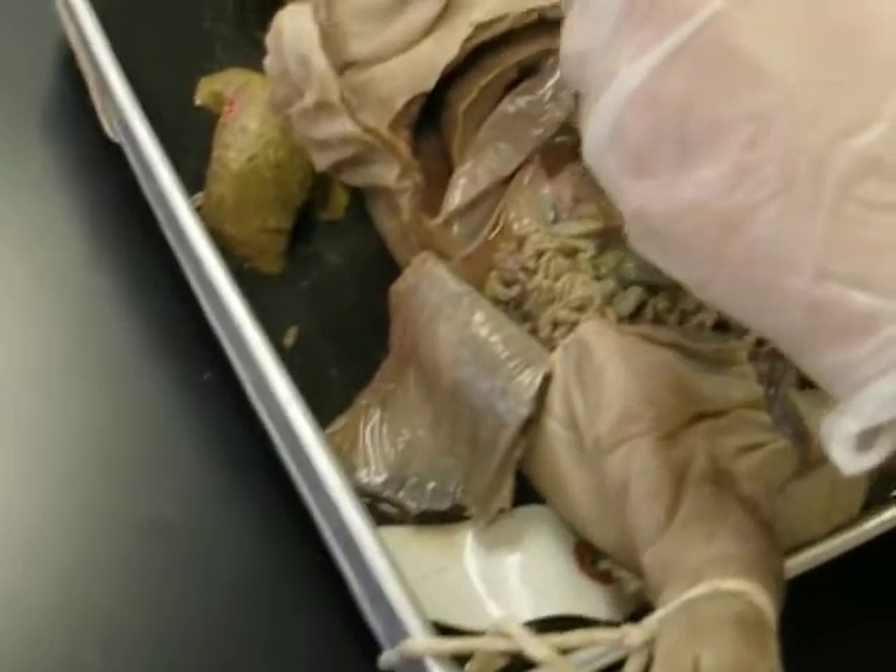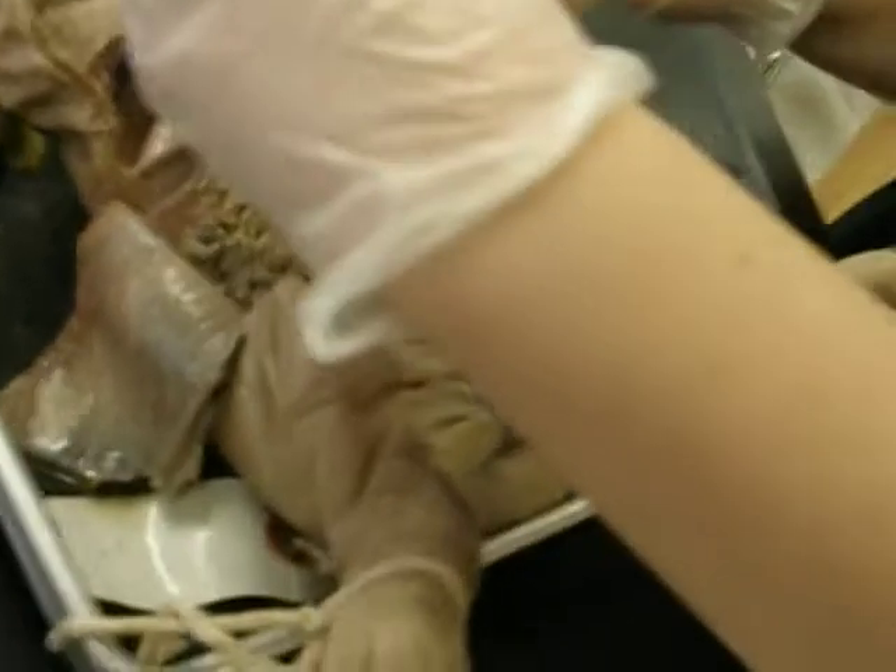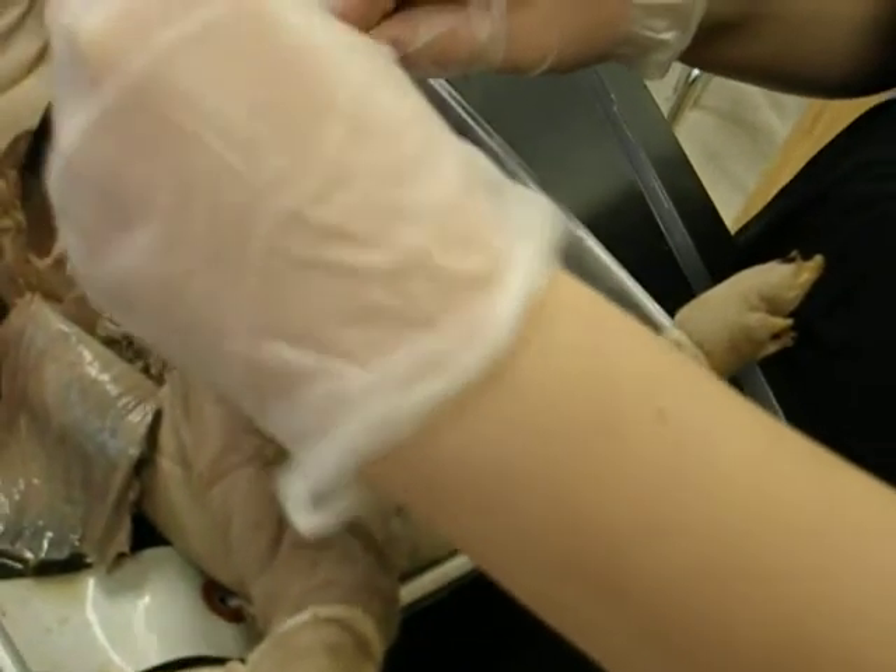The camera can't see anything. This thing is such crap. Okay, so it joins here, by the way. So you want me to cut there? No. Open the upper surface of the stomach, beginning where it joins the esophagus and extending... Oh, here. Extending to the junction of the small intestine. So here. Yeah.